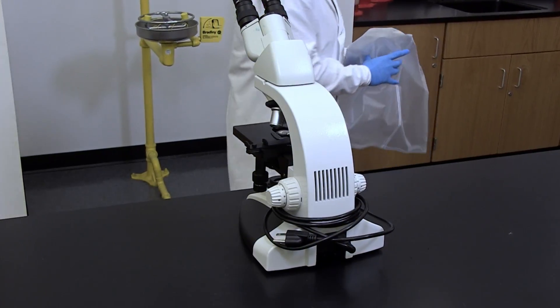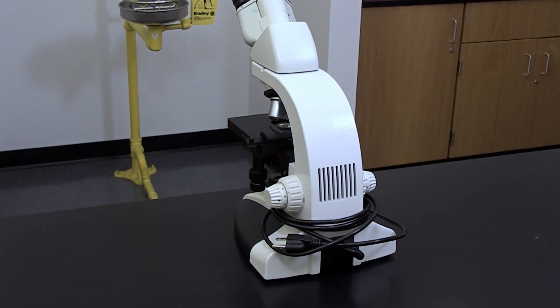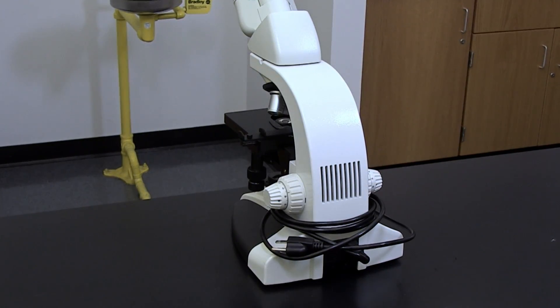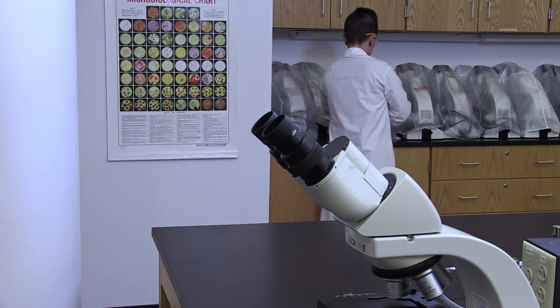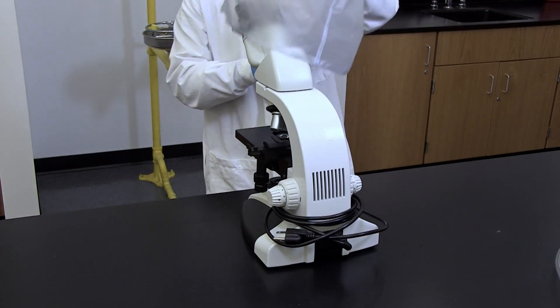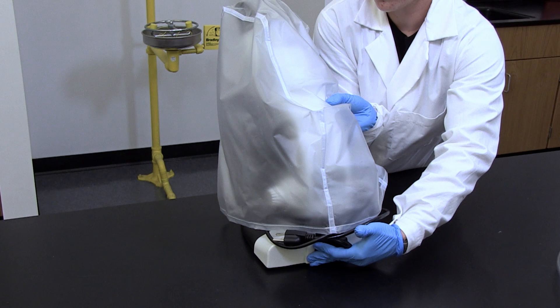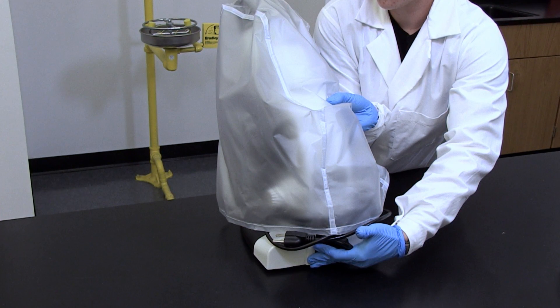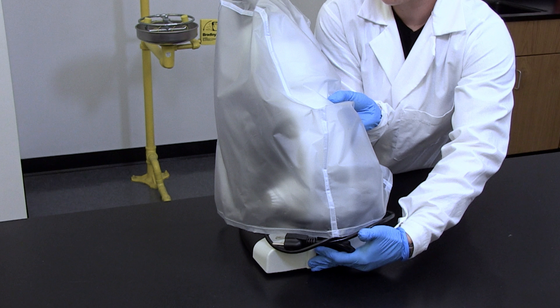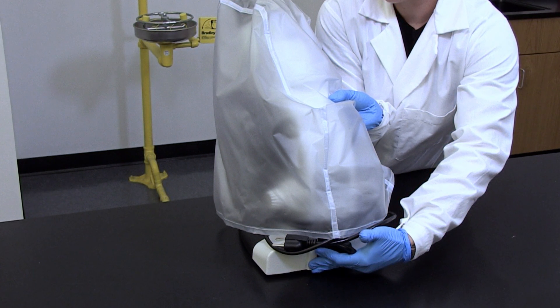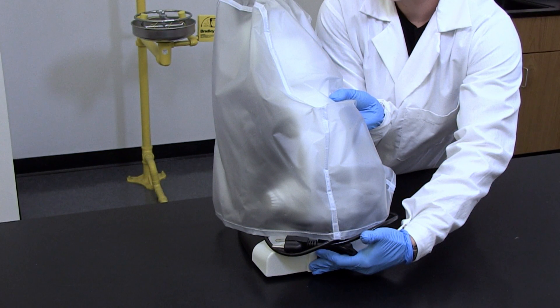Keep excess electric cord secured or wrapped loosely around the base of the microscope to decrease the chance of it becoming entangled or coming in contact with water. To protect the microscope against dust and chemicals, be sure to cover the instrument at the end of the lab period while staining or undertaking any other procedure that could splatter your scope with dyes or chemicals.